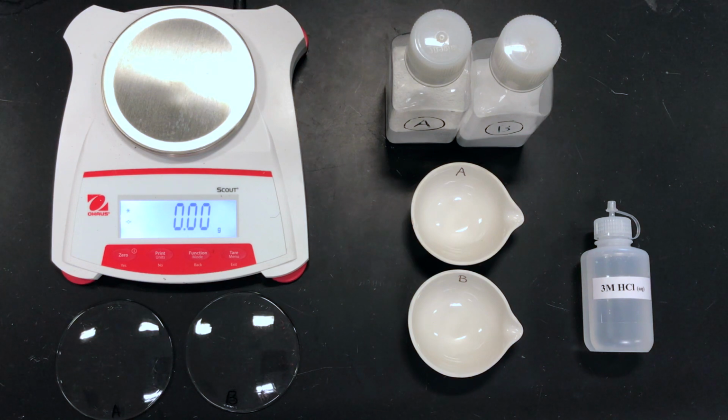excess hydrochloric acid to produce CO2, sodium chloride, and water. They have very similar reactions. However, there is a slight difference in the stoichiometric coefficients that will lead to different amounts of sodium chloride that we can determine from which salt we started with.